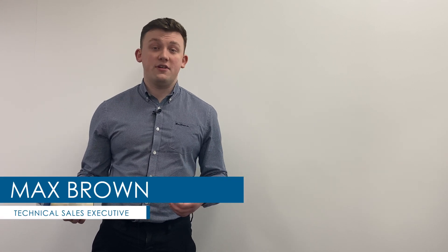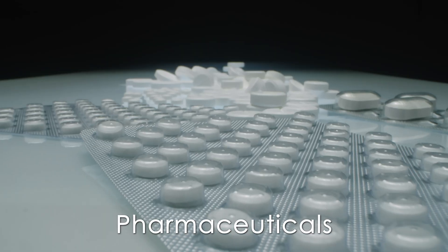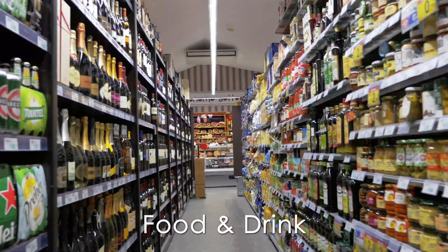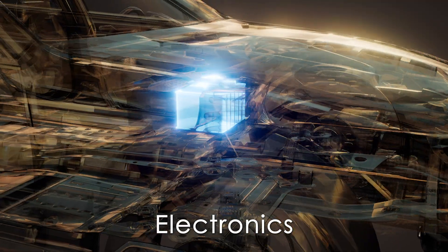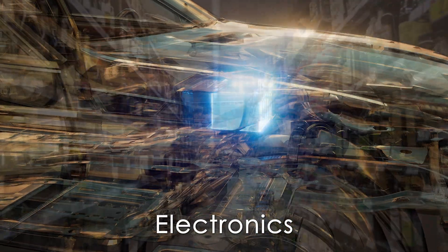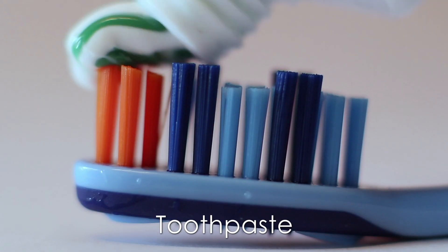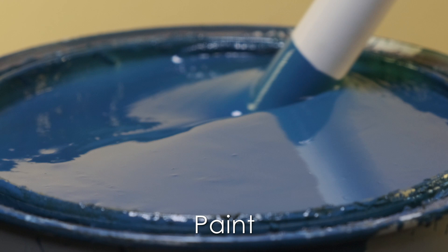We work in a range of different industries, from pharmaceuticals to food to electronics and anything else in between, and anyone that's working with either a semi-solid or a liquid will be really interested in a viscosity profile.